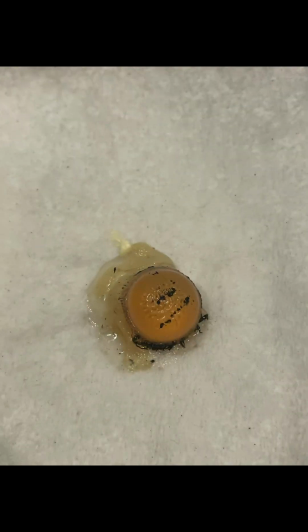The lens is located in the eye. By changing its shape, the lens changes the focal distance of the eye. In other words, it focuses the light rays that pass through it and onto the retina. In order to create clear images of objects that are positioned at various distances, it also works together with the cornea to refract or bend light.